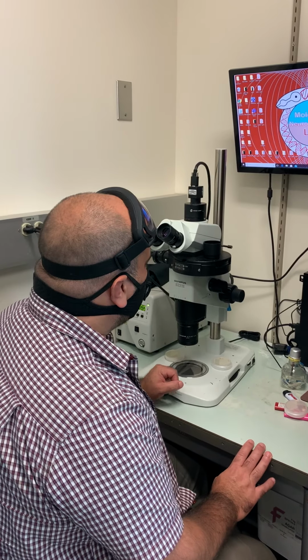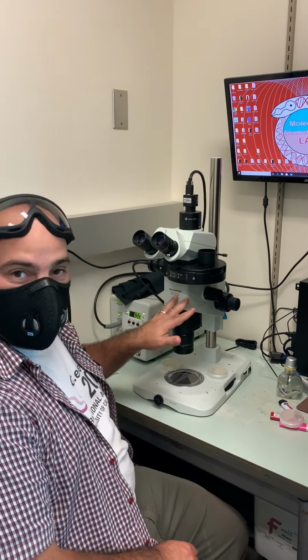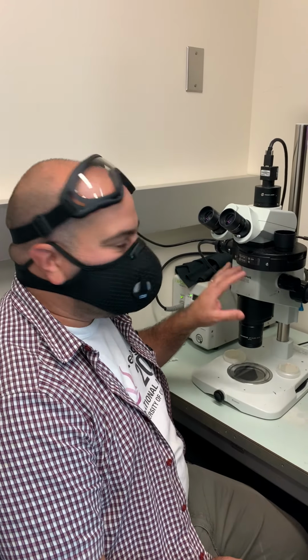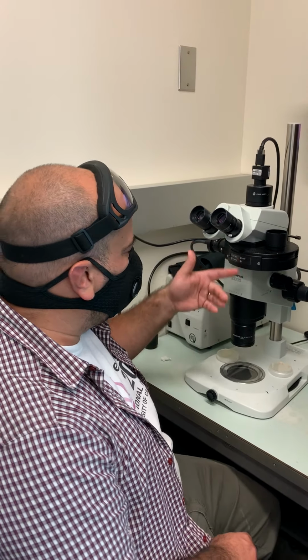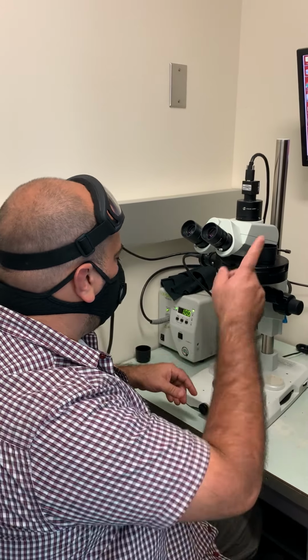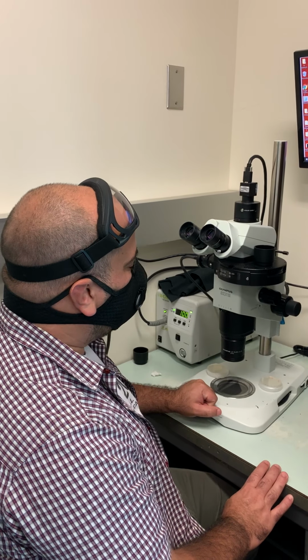Alright, so this video is just to show you how we're going to use this microscope to make calcium movies so that you can analyze the muscular activity of worms. I'm going to start by giving you a brief background of the scope, the software that we're going to use, and the light source. Those are the main things that you're going to be worrying about.